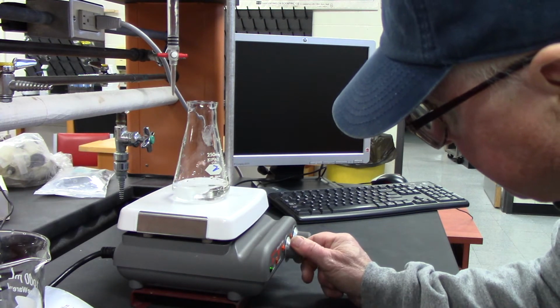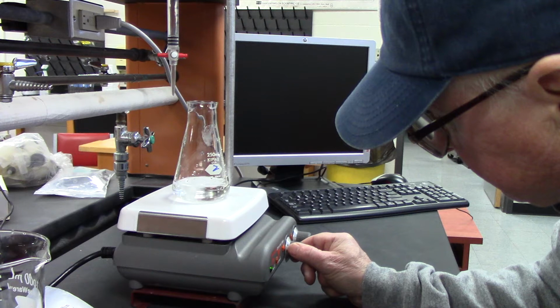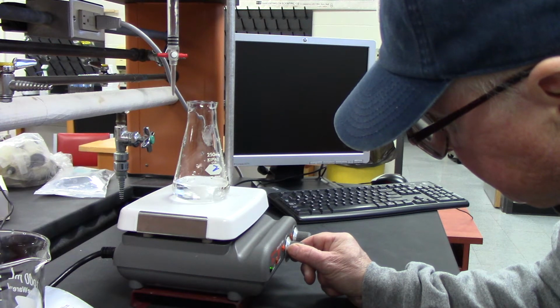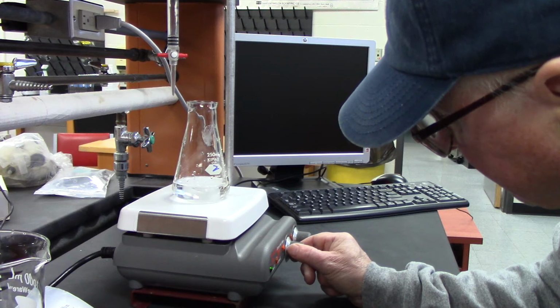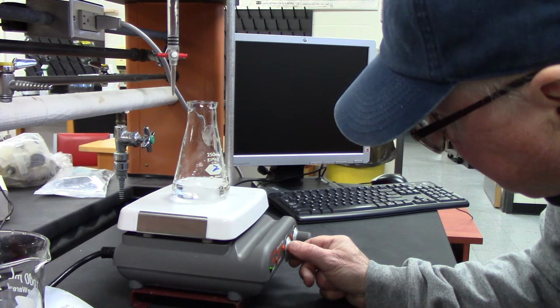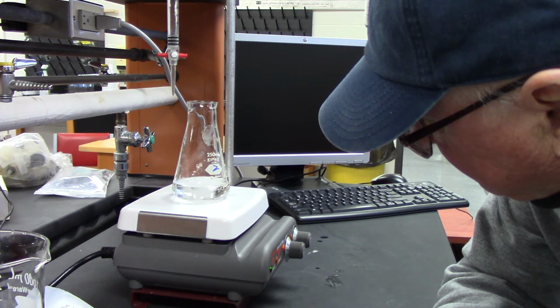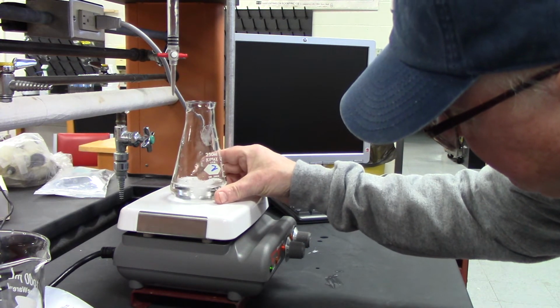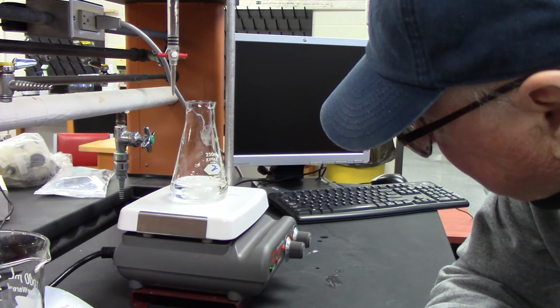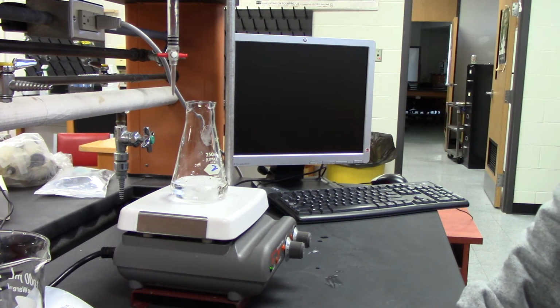You want to get rid of those guys. Okay, so the crystals are all gone.